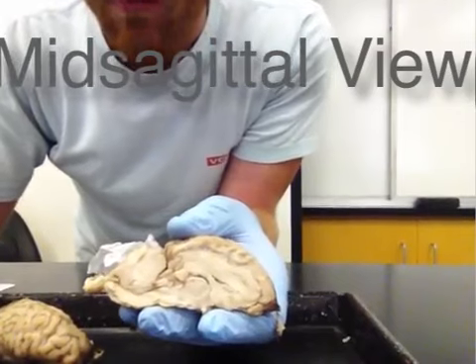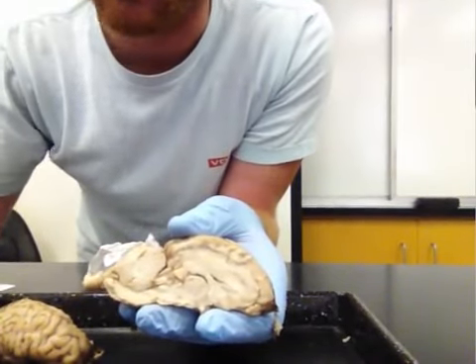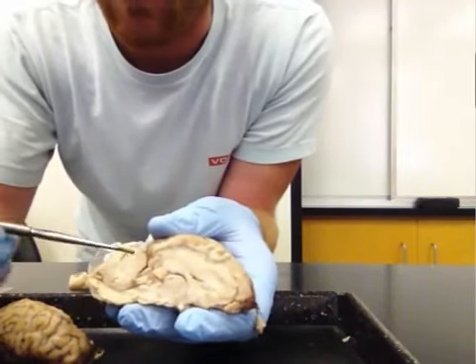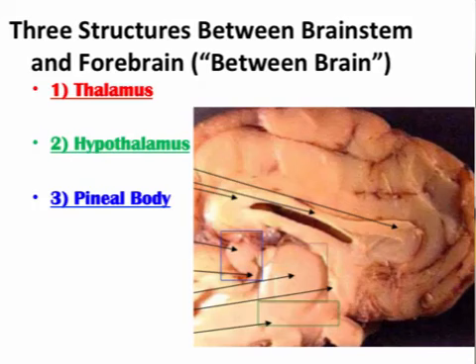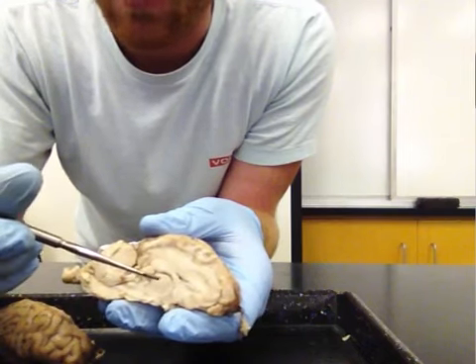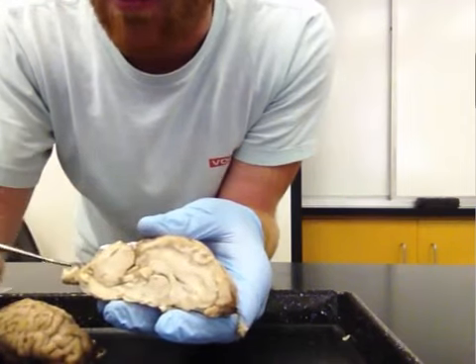Okay, so now that we've made our mid-sagittal cut, we can actually start seeing some structures that we couldn't see before from the external surface of the brain, structures that are embedded inside the brain. And a lot of these structures are going to be what are known as the between brain or diencephalon. It's between brain, right, because it's located between the forebrain, where the cortex is, and the brainstem.